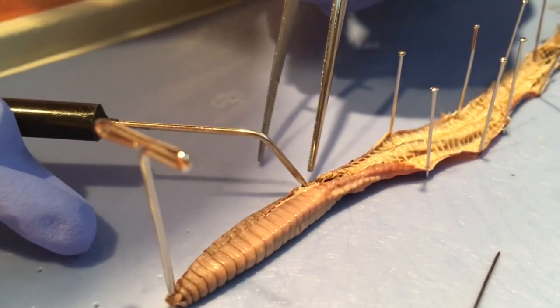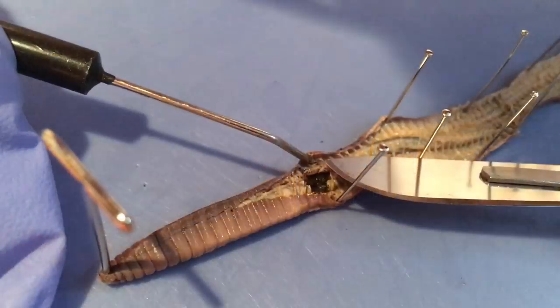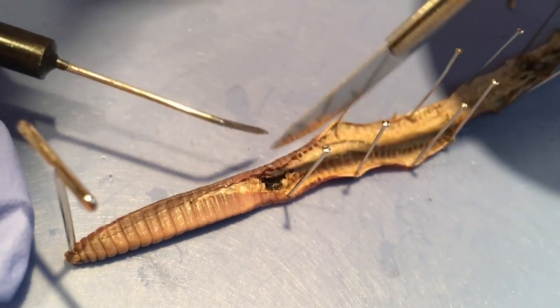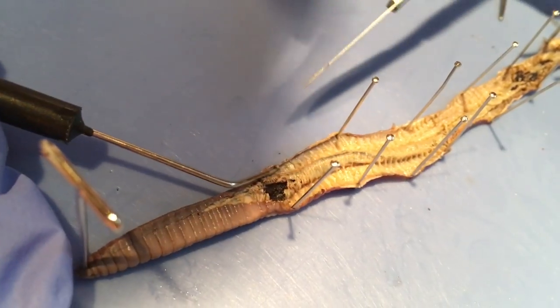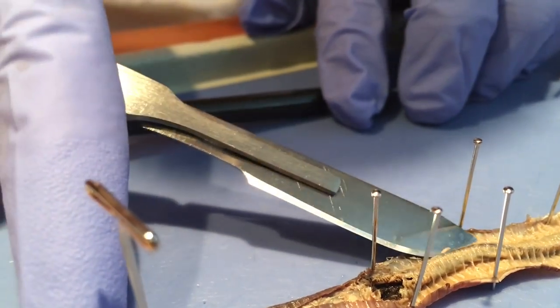Did you find some crap? No — wait, I did. Got it cut back. Now I just got to cut the stringy strings off this. It's kind of shiny in there — look at that. I'm going to lift this up a bit.